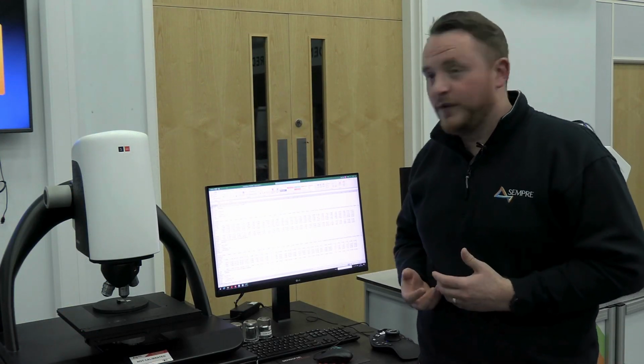Hopefully you can see how powerful the software is for outputting data automatically in a CSV format.